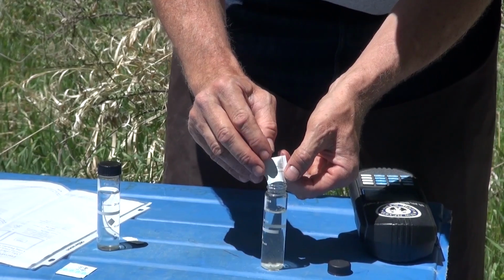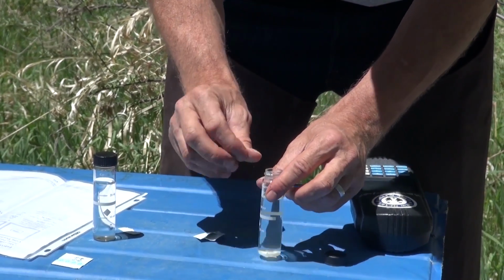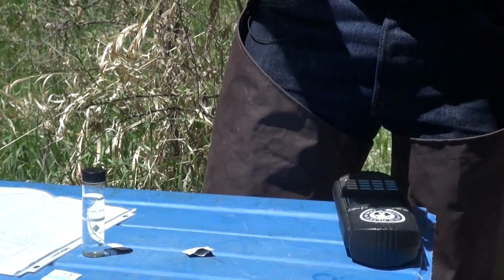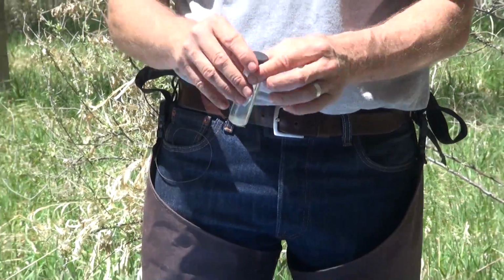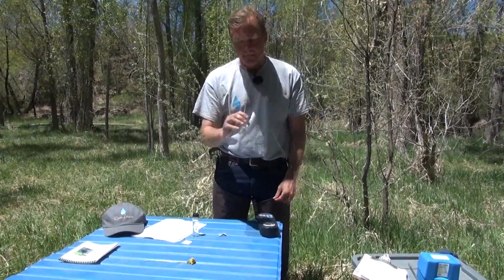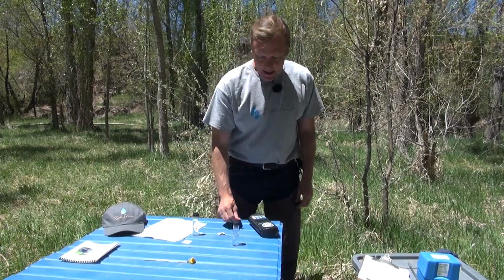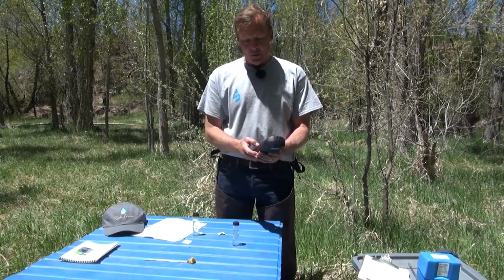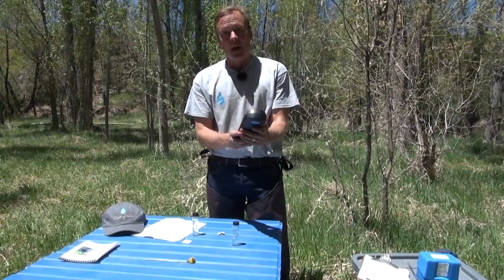And then I'm going to give it a tap. And then I'm going to cap it, and then I'm going to use a timer to measure 15 seconds, and I'm going to shake it for 15 seconds. Okay, now my timer says I've shaken it for 15 seconds, and now I need to press the timer on this machine, and it's going to count down from 2 minutes. And then when it's done, it's going to beep.